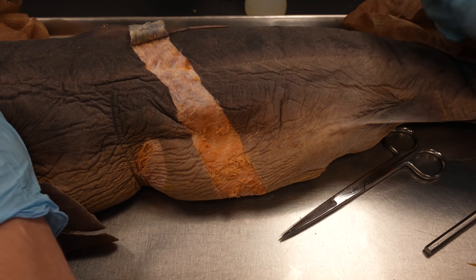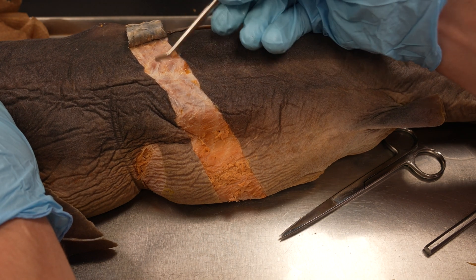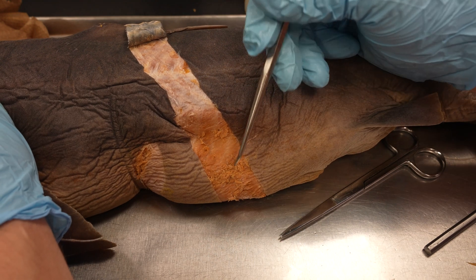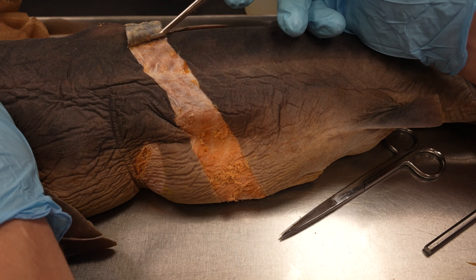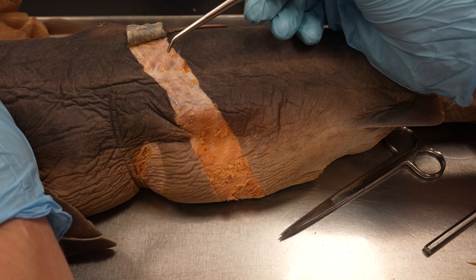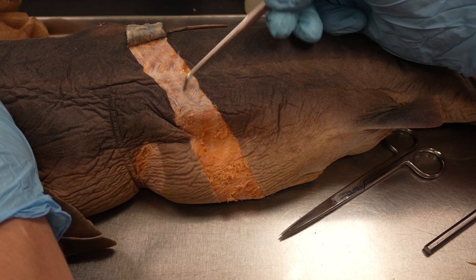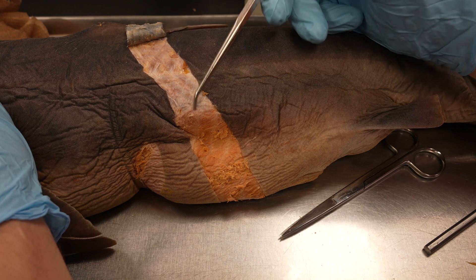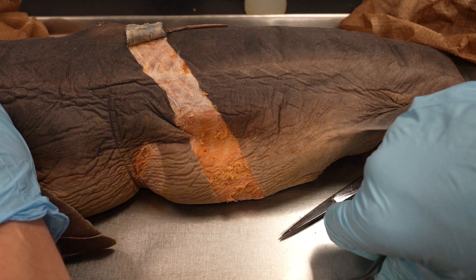All right, so it's not the prettiest, but we have successfully cleared the skin all the way along the body wall of the shark. Be aware that the fascia, especially down through here, was exceptionally tough — up here it got a little easier. We'll want to clean this up a little so we can see the muscle fibers. You can see they're going in slightly different directions with the epaxial and hypaxial musculature. I'll see you in a bit with the walkthrough.